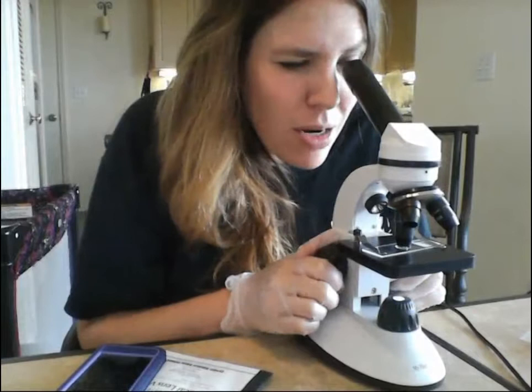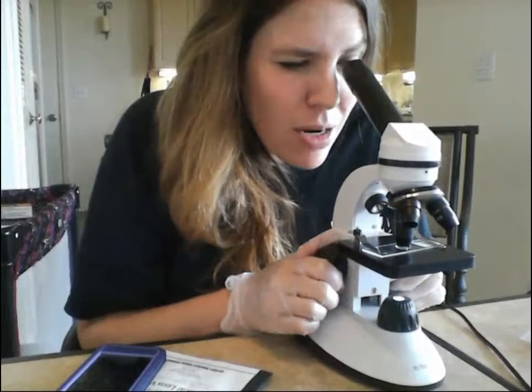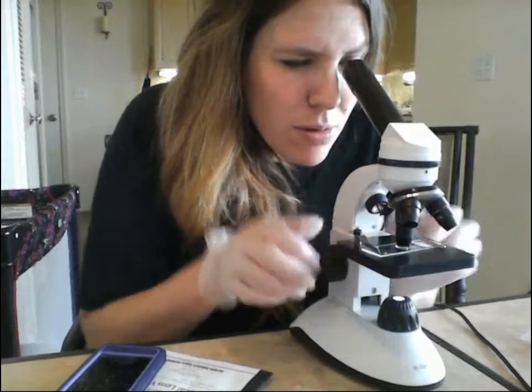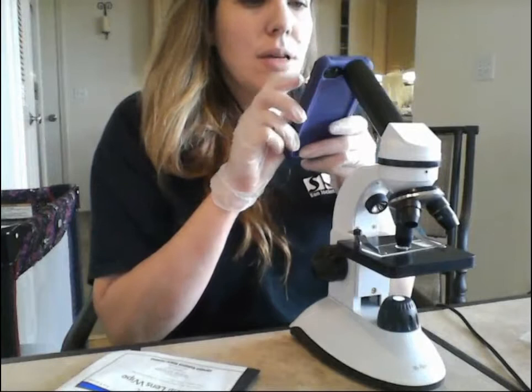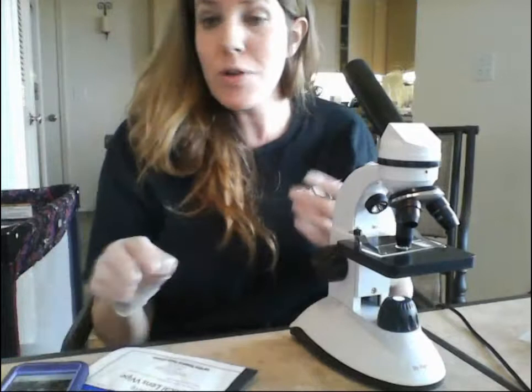I've got mine pretty good there. I've adjusted the focus and can move the slide around on the stage if needed. Then you're going to want to take another picture — so I'll take one here now at the 40x objective for 400 total magnification.